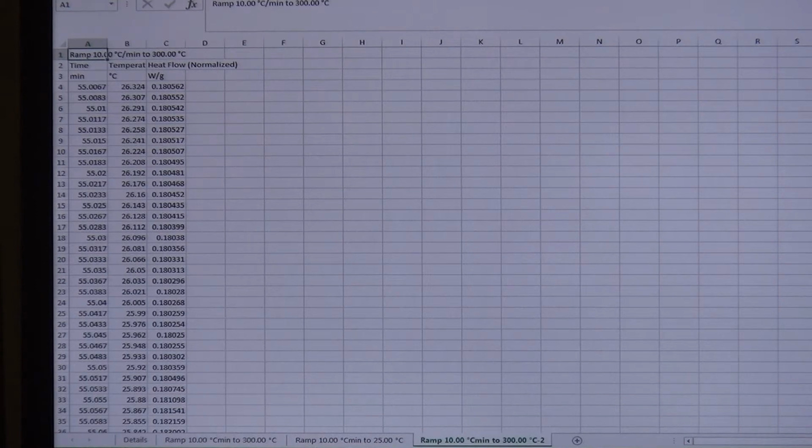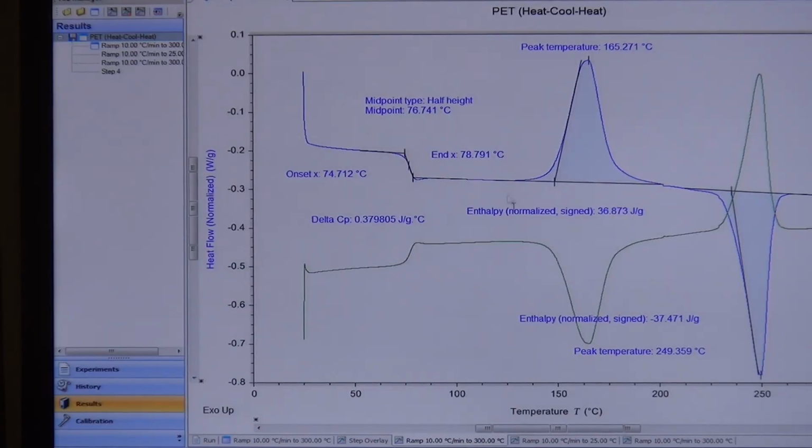So once you have your raw data, you can basically go ahead and do whatever you want with it. You can plot it on your favorite plotting software and things like that. The only thing I would not suggest is trying to do this on other, more generic types of software, simply because the units and the way that it would integrate these things, I don't quite know how it would do that. Typically what they do is fit things to Gaussian curves and things like that. And if you know about Gaussian curves, the area under the curve of a Gaussian has no units. So the numbers that will come out would make no sense. In this program, it knows what these curves are. It knows what the units are. So everything comes out in the correct units with the correct numbers.